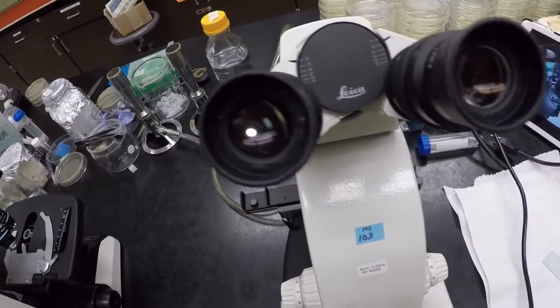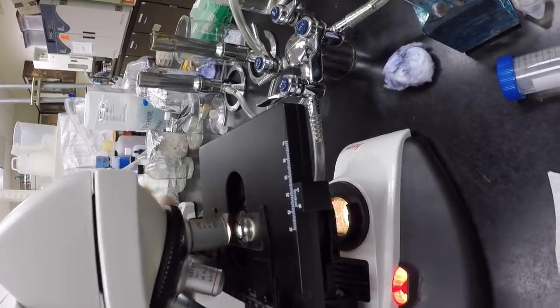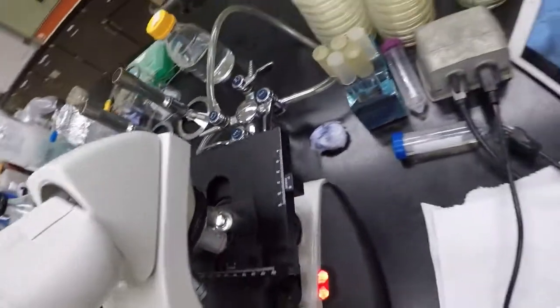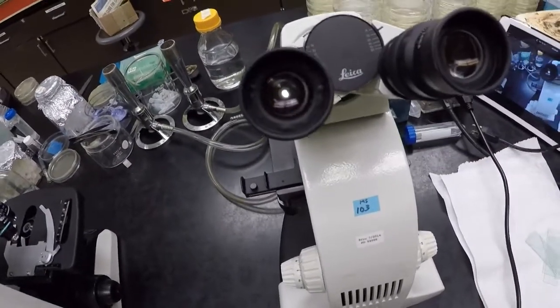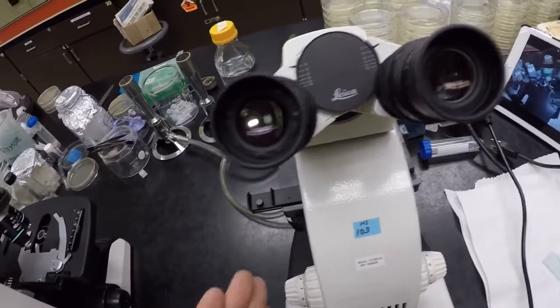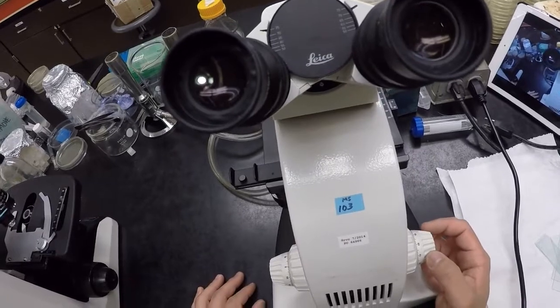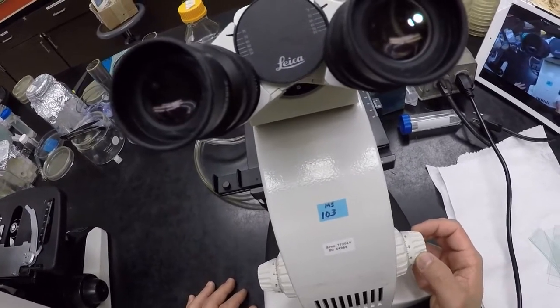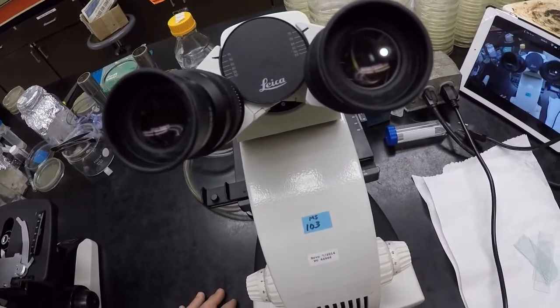In order to do that, we're going to rotate our lens in. Right? So I always like to watch it, but again, our 10 times is our safe lens. Nothing bad should happen, so I'm simply going to rotate it in, and it'll be okay like that, right? Now, this microscope is what's called parfocal. That means the focal length for all lenses are going to be the same. So once I move in the 10, it should already be in focus. So from here on in, all I really need to do is touch the fine focus, right? So you just go and fiddle with the fine focus, and then it'll be in focus for you. All right, so we're good.